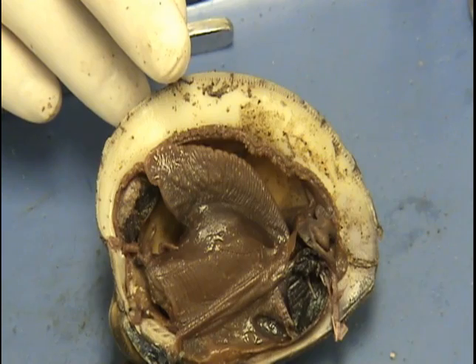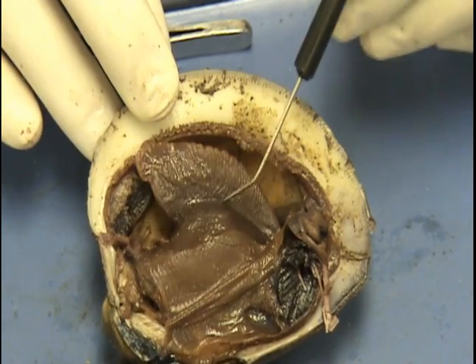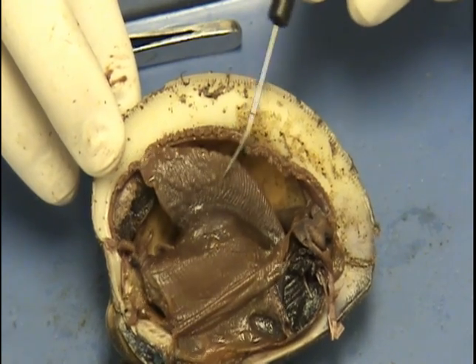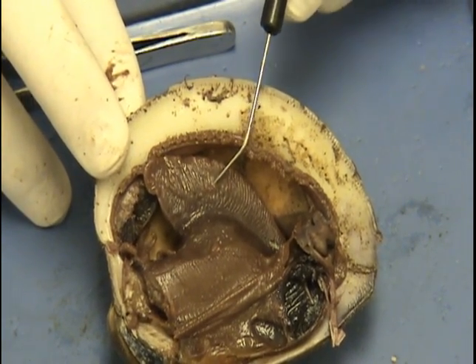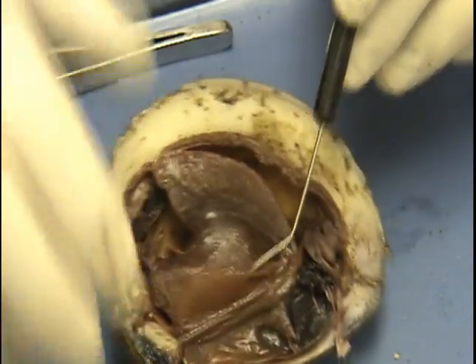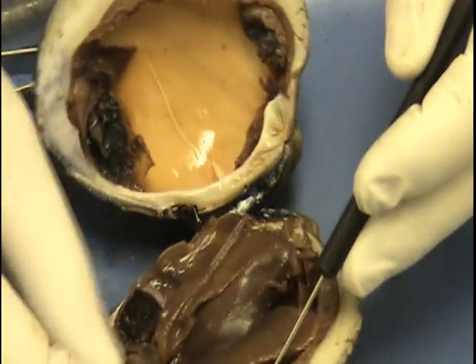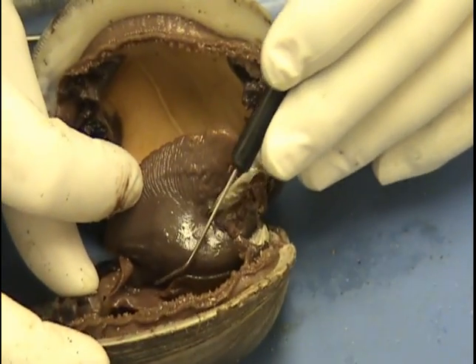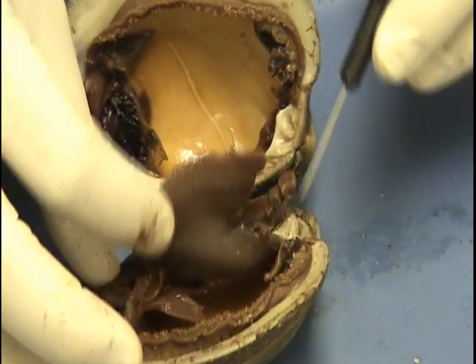Here's the foot — it's a very, very muscular foot. This foot extends outside of the valve and is used for movement. The gills we looked at here — if we turn it around and move the foot, you can see there are gills right down in there as well. Here's the palps again.